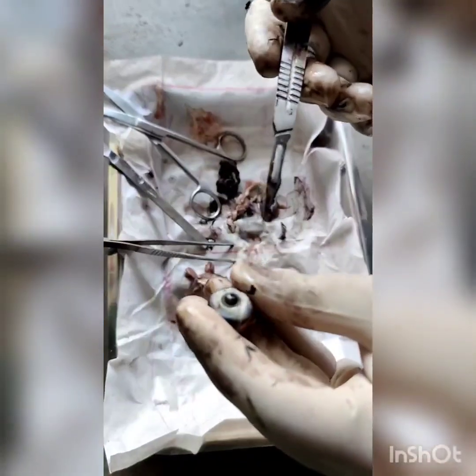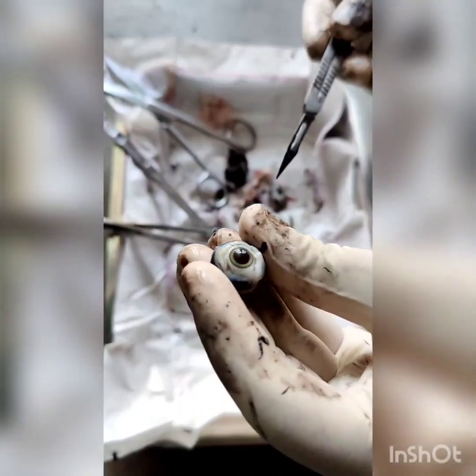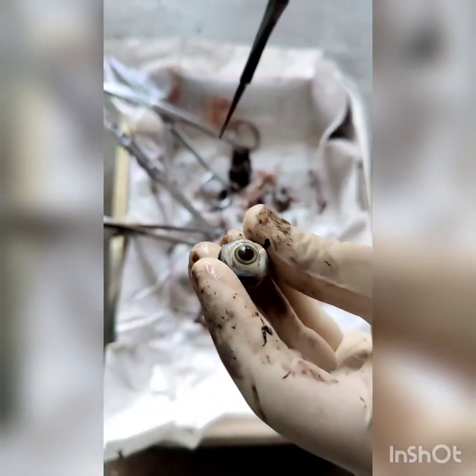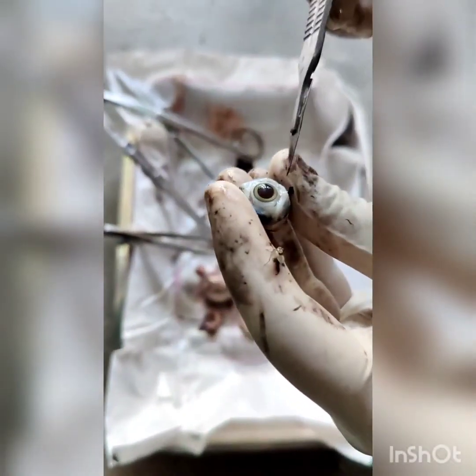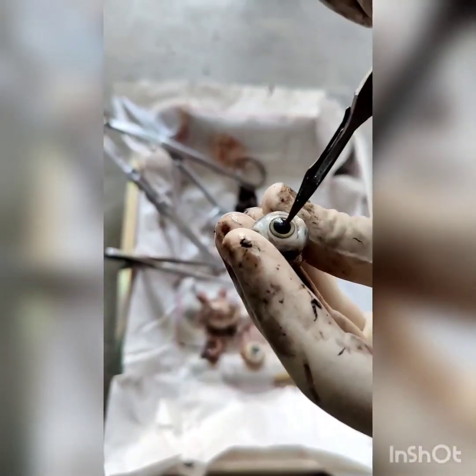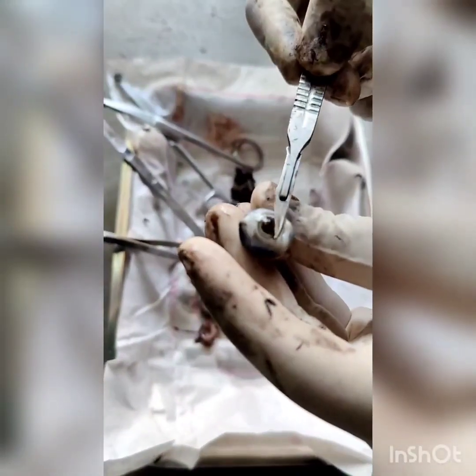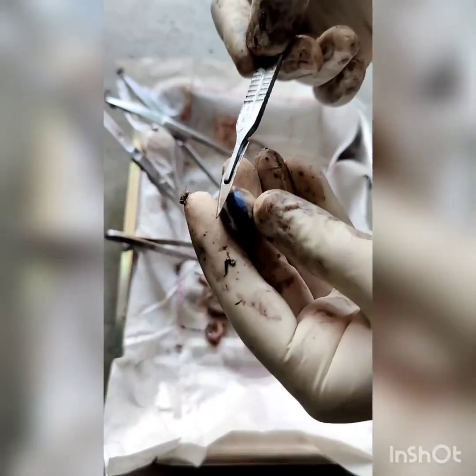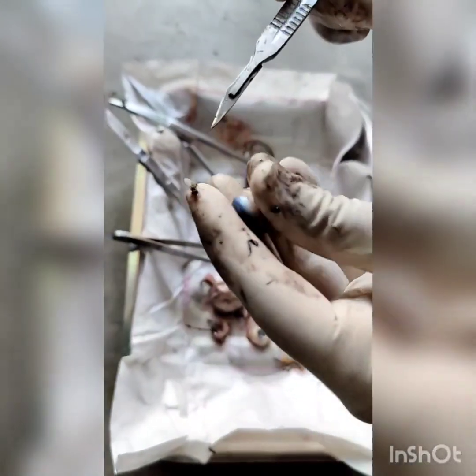This is the last piece of the eye — you can see the shining tapetum lucidum inside the layer. This is a compact eyeball of chicken. Here you can see the lens intact with the iris, and centrally the pupil. The front layer is the cornea, all around is the sclera, that is the optic nerve, and these are the muscles. A very good presentation of the compact eye.